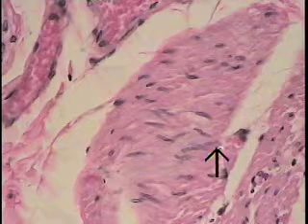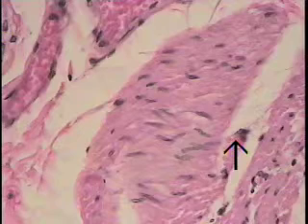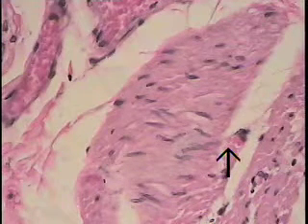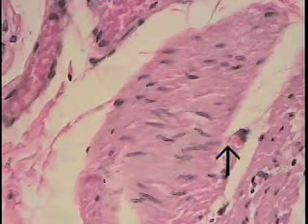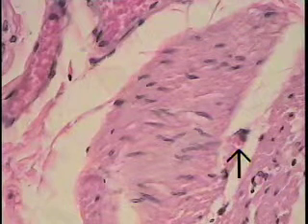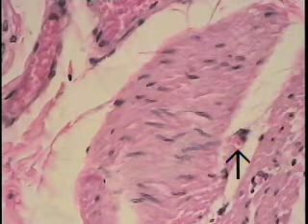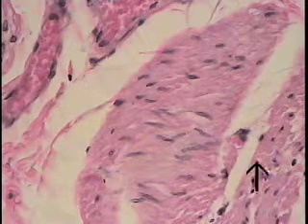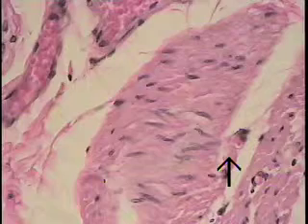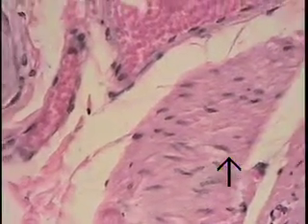It's sort of cut lengthwise and curves around such as this, and it has 3 erythrocytes within the lumen, and even though the nuclear profile cannot be seen on this side, one can see the very thin wall of the endothelial cell cytoplasm.